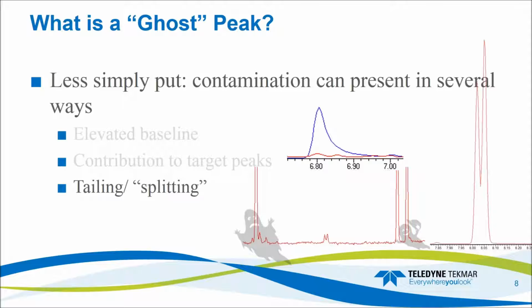It makes integration tricky. And then similarly here with this larger peak, is this split or is it two peaks co-eluting? So is this a contamination issue, or is it an application issue with our method parameters? And then how would you integrate this? Would you simply cut it right at the valley there? Do you need some of that area over here where that tail would have been for the first compound in order to get an accurate calibration? So what can we do to clean that up?